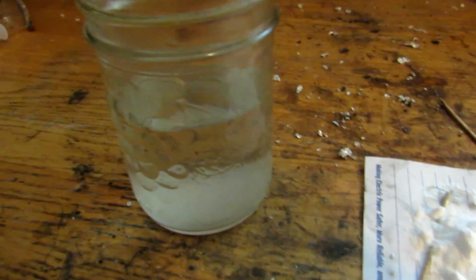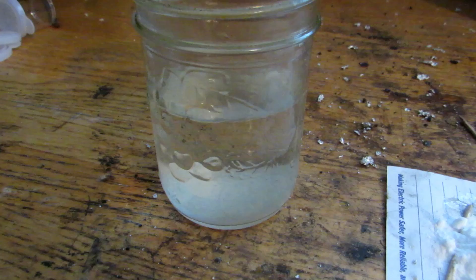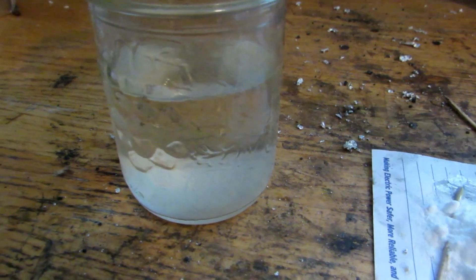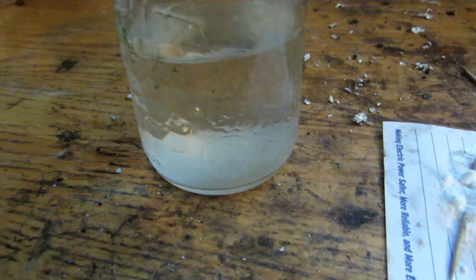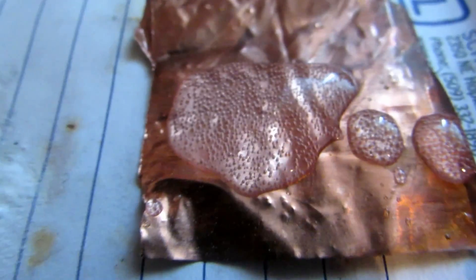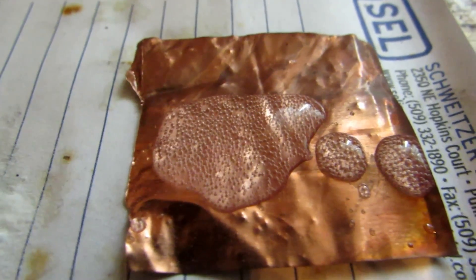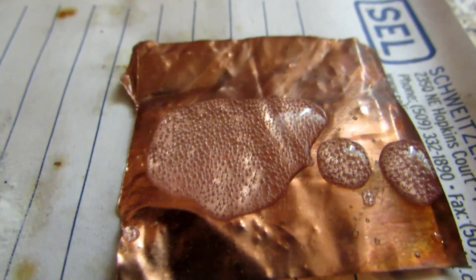Now this acid is extremely weak, but luckily I have a distillation set coming in the mail in a couple of days which I ordered online, so we'll be able to distill this. Sadly, you won't be able to distill this without a proper distillation setup because it's so corrosive and any homemade thing will be dissolved by it. If you don't have a distillation setup, save your weaker nitric acid and simply repeat the process several times — every time you repeat the process it will become stronger and you'll get higher concentrations. Alternatively, do not use as much liquid, because if you just have a small amount then it will become concentrated much faster. You can definitely see that it's a fairly good nitric acid, and we're going to be using this to extract all sorts of different metals in the future. Nitric acid plus hydrochloric acid creates something called aqua regia, which can dissolve metals like gold, palladium, and platinum. So this is probably your most viable way of getting nitric acid, and I hope you enjoyed.